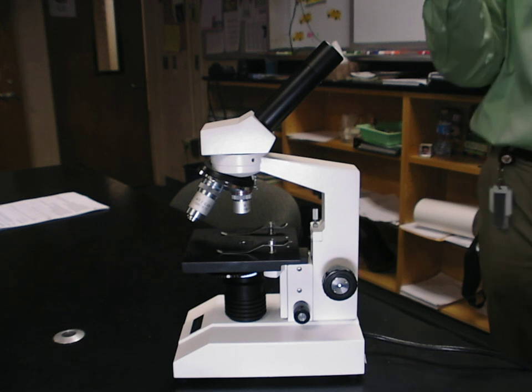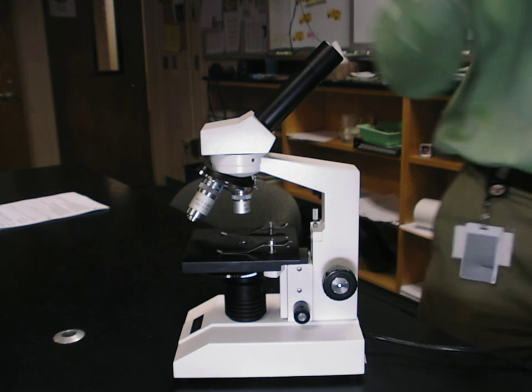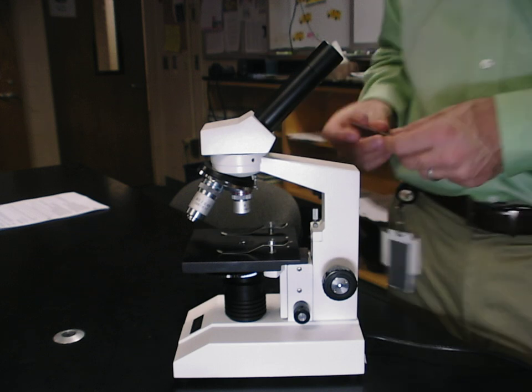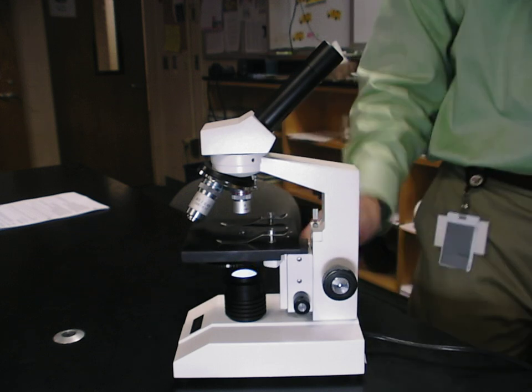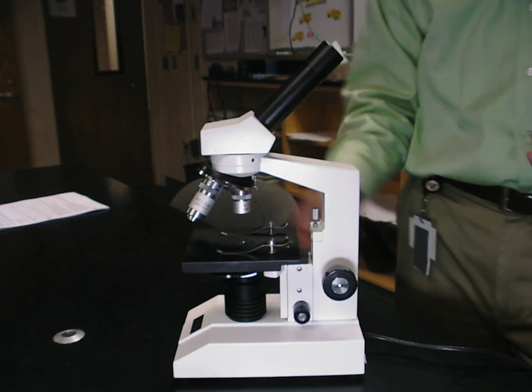The first thing you're going to do is take whatever slide it is you're going to use. I'm going to show you an example using a cork slide. You put the microscope stage all the way down, so this is all the way up, you put it all the way down.